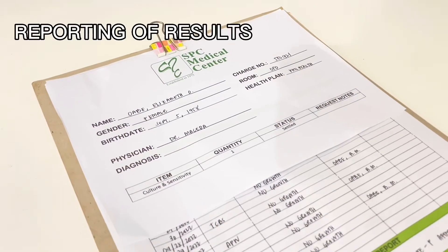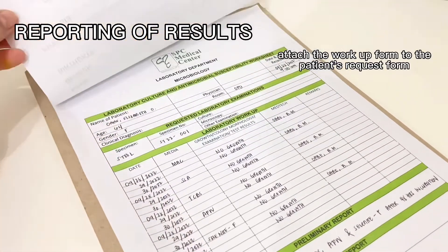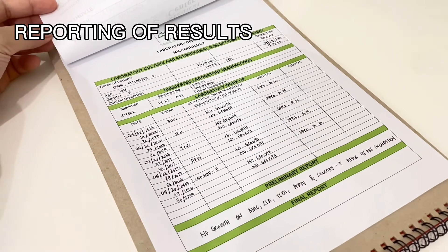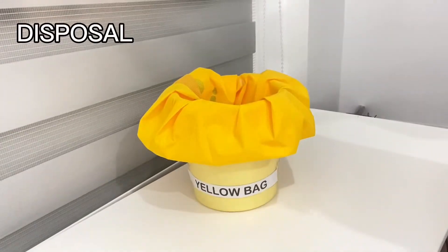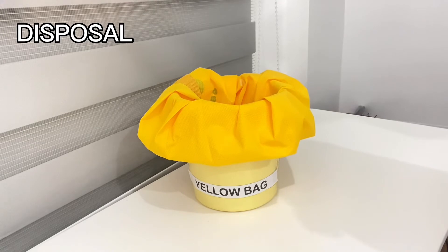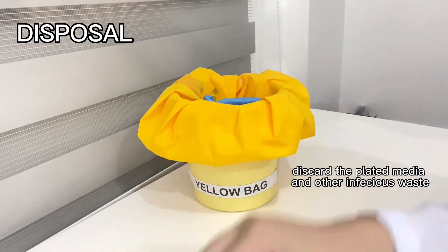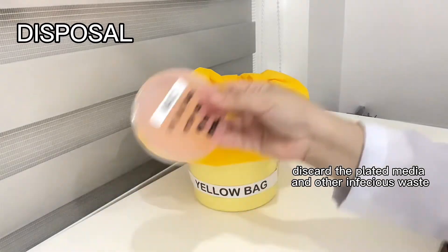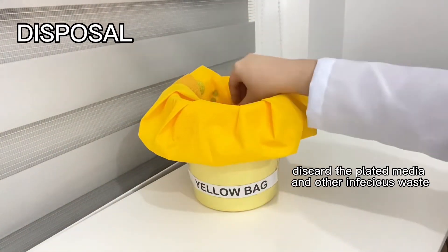After 48 hours of incubation, report the results. Write the results and attach the workup form to the patient's request slip. Then after the procedure, observe proper disposal of plated media and other infectious waste. If disposable loops are used, they must be thrown in a bottle with hypochlorite solution.